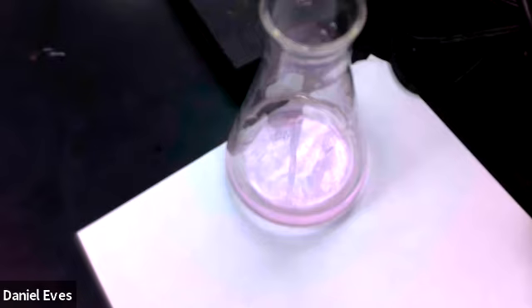But we'd go ahead and calculate the concentration of the sodium hydroxide by determining the number of moles of sodium hydroxide, which should be equal to the number of moles of potassium hydrogen phthalate, and then dividing it by the volume. So for the first one, it would be 27.05 milliliters, and for the second one, it would be 27.7 milliliters.